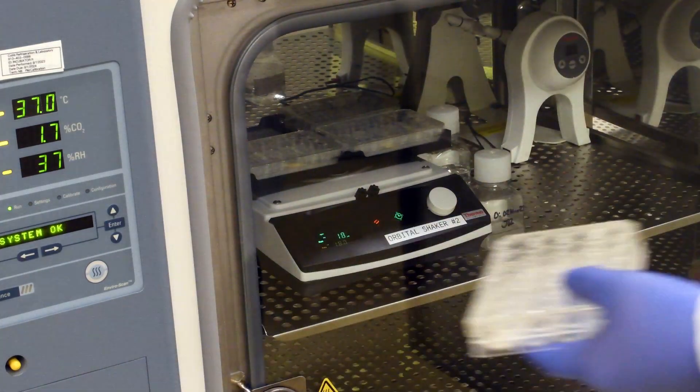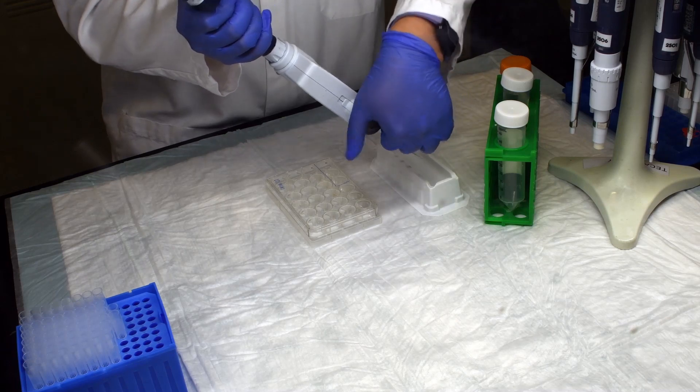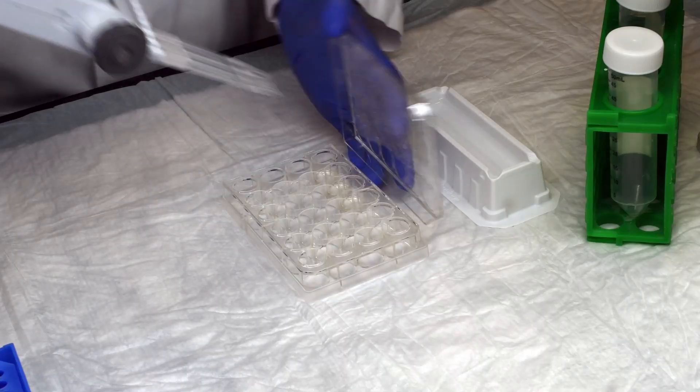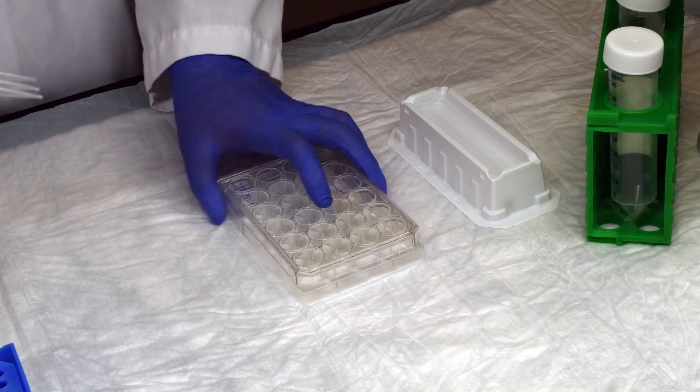At each time point, remove the appropriate plate from the incubator and use a multi-channel pipet to add one volume of stop solution to the incubation wells. This will stop all metabolism in the wells and is commonly referred to as crashing the incubation.